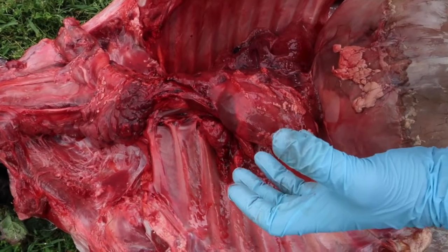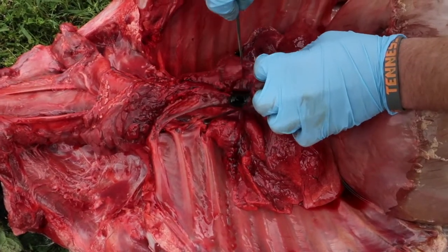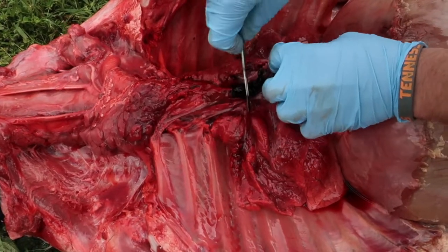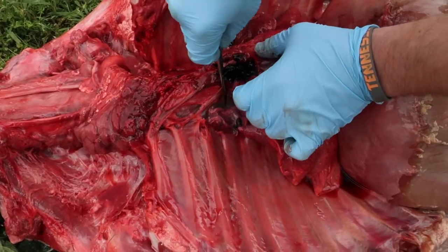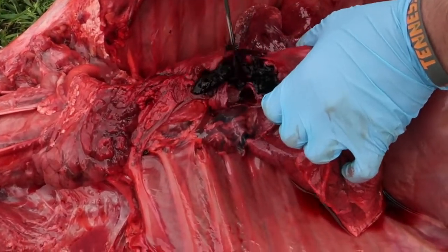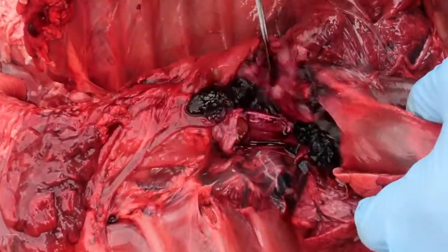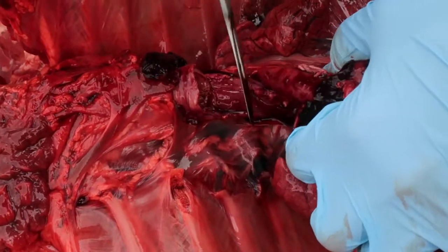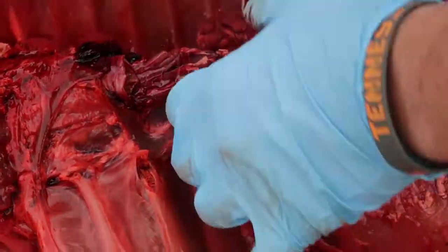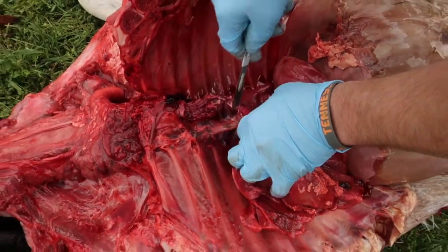Okay, so I'm going to go ahead and dissect the heart out for you so you can take a look at the heart and some of the different structures here. Cut through the vena cava there. We're going to cut to the top of the heart. You can see the blood clot is formed inside there. And what I've cut through here, you can see the part of the trachea that I've cut through. Let's go through a little bit further. Okay, and I'll try to remove the whole, the lungs and the heart for you.